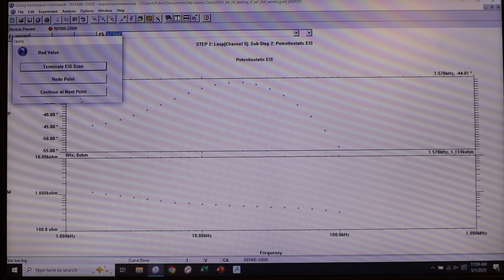We can run our cyclic voltammetry, and it works fine. The very first step is always to make sure that your reference, counter, and working electrode aren't touching. They're all plugged in. There's no connectors that are submerged in the water as well. All the connectors are touching. The connectors aren't touching some other metal that's not a part of your system. Everything's plugged in.